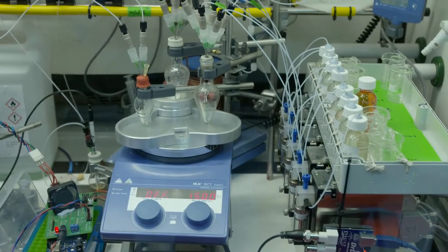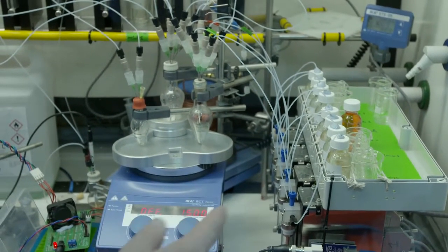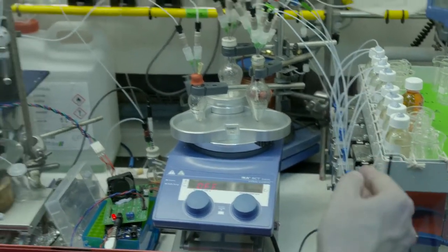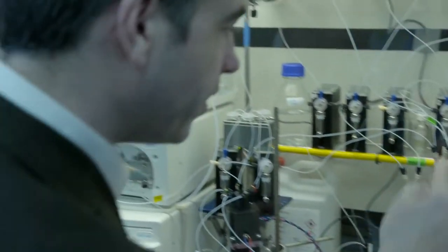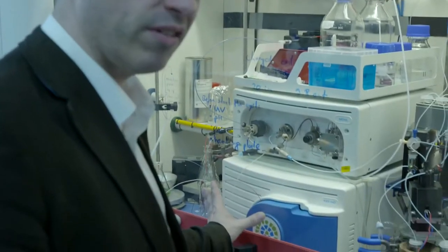So let's go to the Finder and explain how it works. What we have here is an automated cocktail maker: the ingredients for the chemical cocktail are up here in these vials, and the pipes take them into the pump. The computer selects which one — gin and tonic, Bacardi, whatever — checks them randomly, and then mixes them in these round-bottom flasks to start making the cocktail. It will look to see if anything has happened, then move it to the back and heat it up to make the reaction go — like putting it in the oven to cook it.